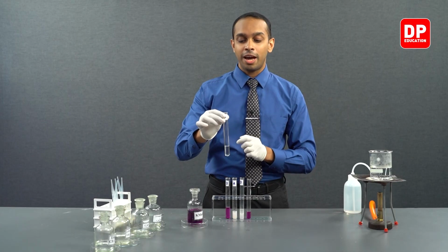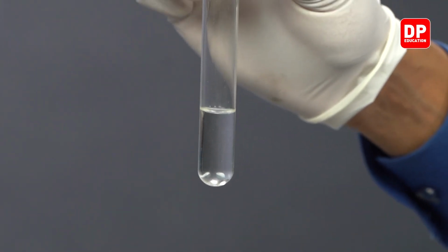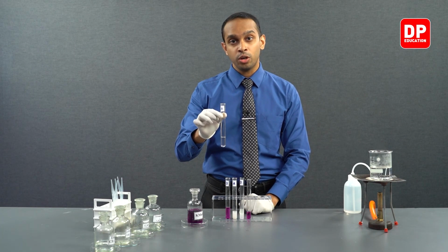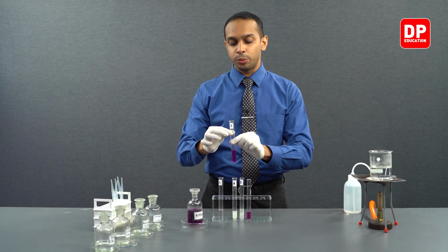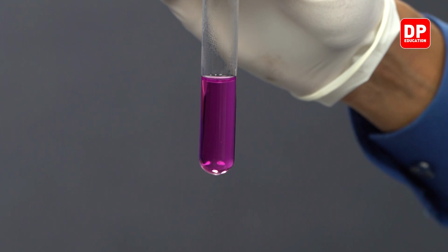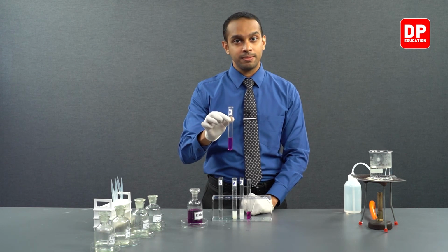So we can see here we have acetaldehyde that has gotten oxidized to acetic acid or ethanoic acid. And in doing so, the permanganate ions got converted into Mn2+, which were colorless. But aliphatic ketones do not show a reaction with acidified potassium permanganate. So therefore, we can come to the conclusion that with acidified potassium permanganate, aliphatic ketones cannot be oxidized.